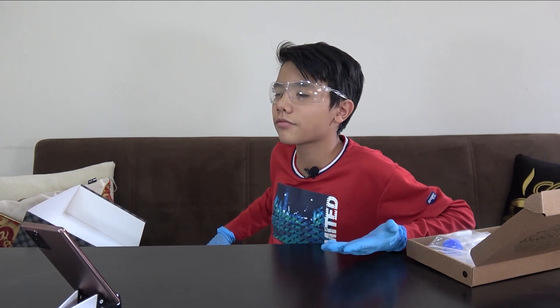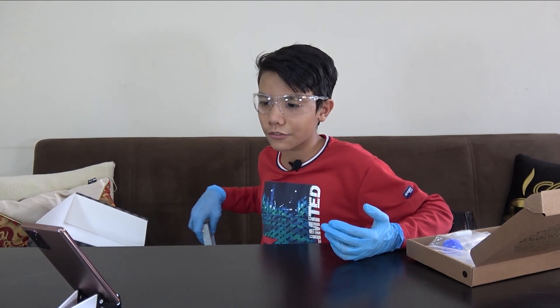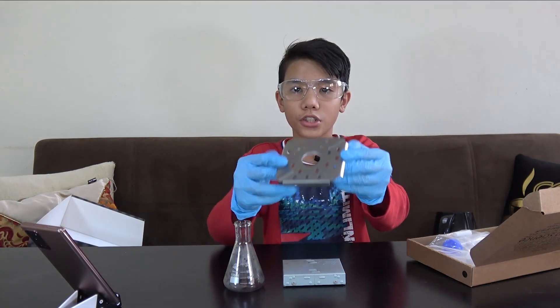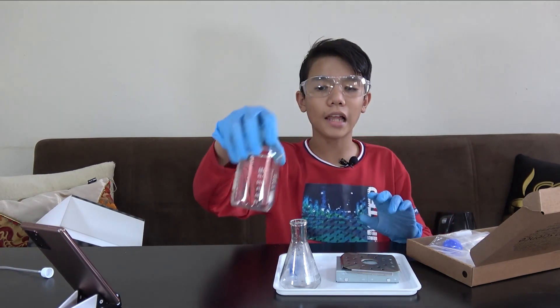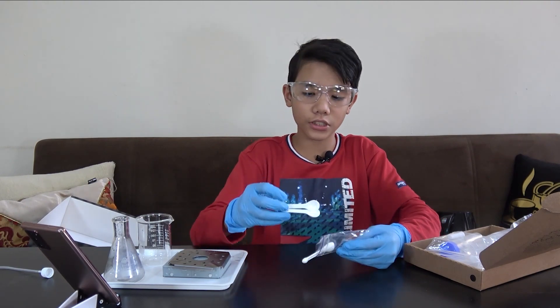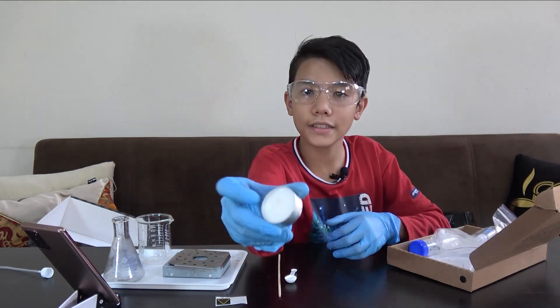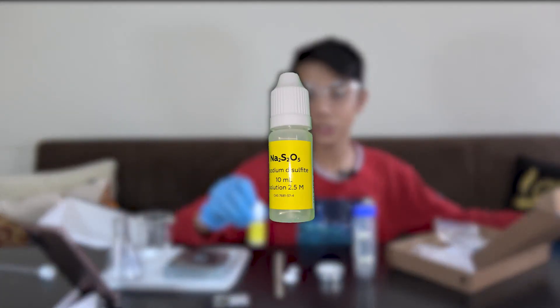This will be a very fun experiment because we're going to be playing with fire — well, not really. First, we're going to take from the starter kit: a pocket stove, a glass flask, safety glasses (which I'm already wearing), a flame diffuser, a plastic tray, a rubber stopper with one hole, and the glass beaker. From the set we're going to take a double-ended measuring spoon.